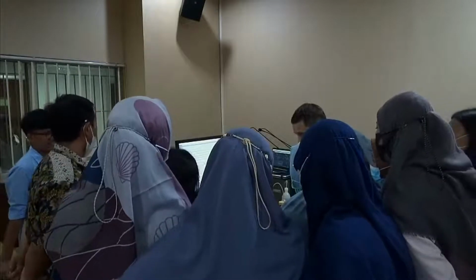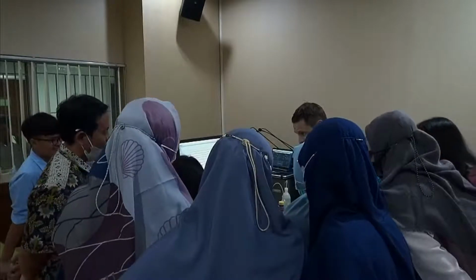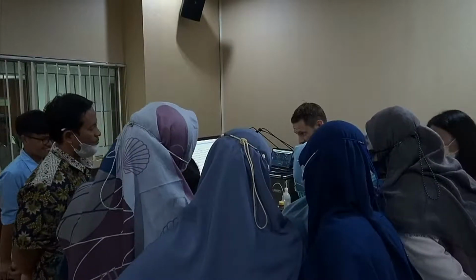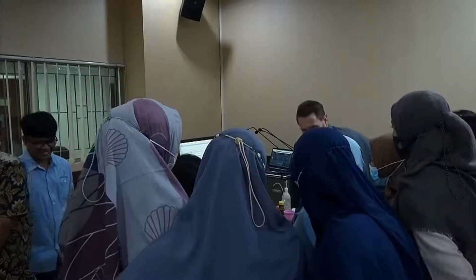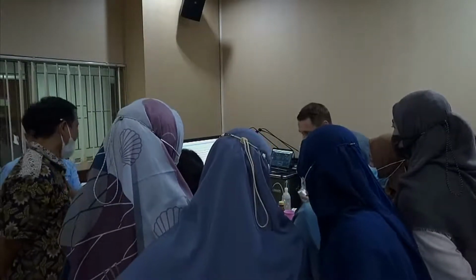What I will change here now, you see down below, there's our calculation, which I talked about, and we have it set to Fraunhofer theory. But I know this material very well, of course, because it's our internal standard, so we could actually use Mie theory.